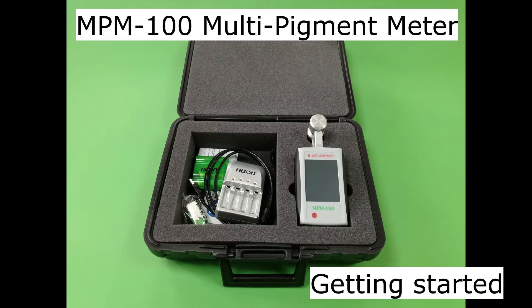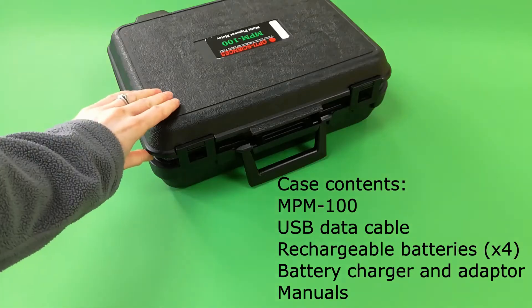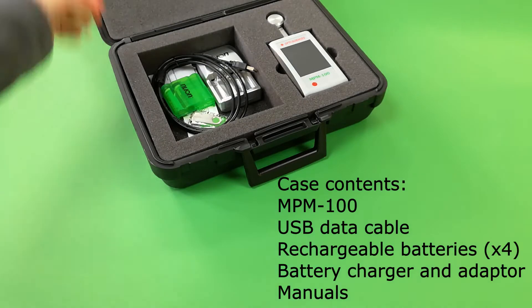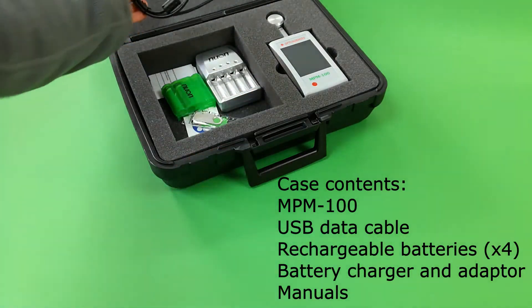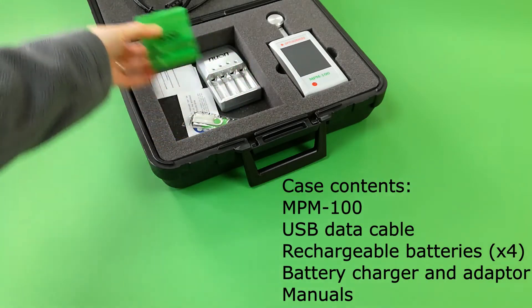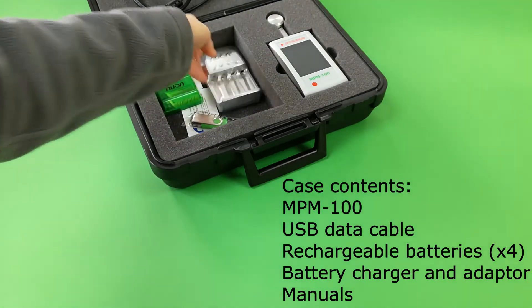Getting started with the MPM100 multi-pigment meter. Inside the carrying case is the MPM100 unit, USB data cable, four rechargeable AA batteries, charger and local adapter, and manual on USB stick.